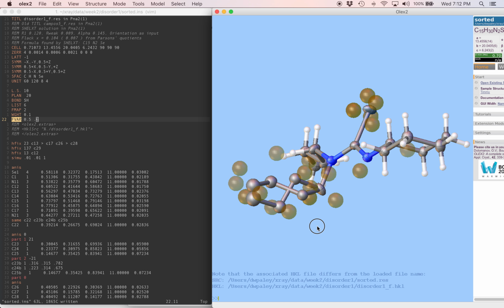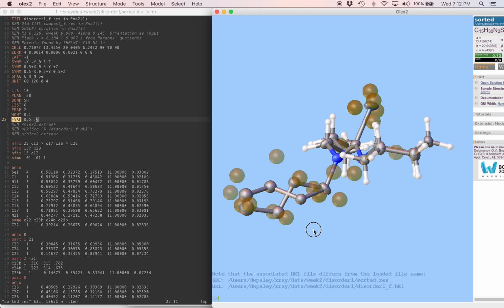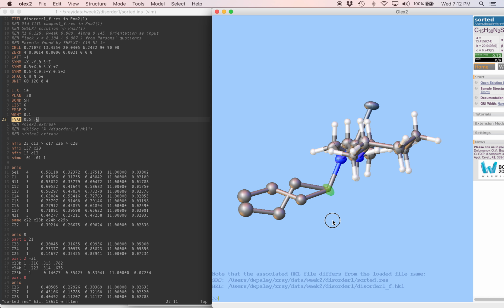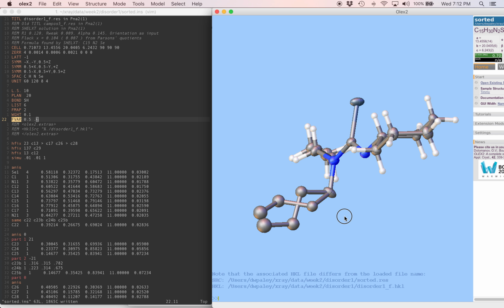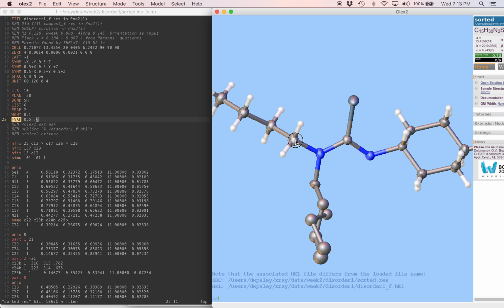Okay. Well, this is looking good. The next thing we're going to do is add hydrogen atoms to the two disordered parts. That's straightforward for the actual disordered atoms, but it's a little less straightforward for the first ordered atom. And that's because when you put in hydrogen atoms, you need to look at the neighbors of the atom you're putting hydrogens on. When we use HFIX 23, it's expecting to find a carbon with two neighbors, like this one, for example. It has two neighbors, so we know where to put two hydrogens on it.